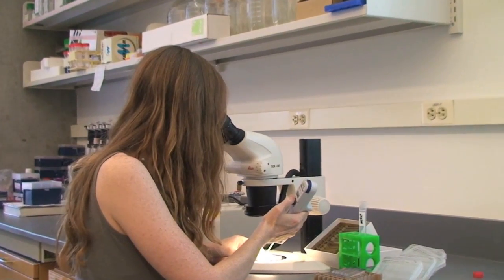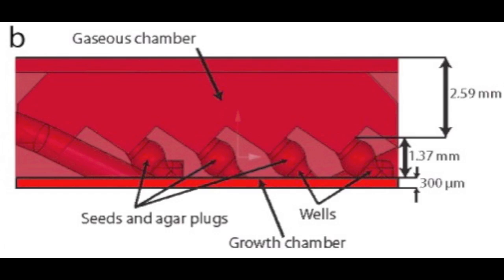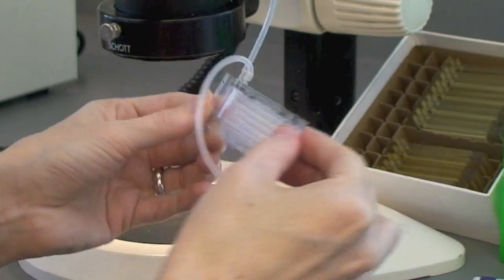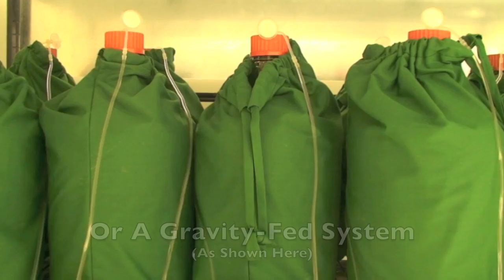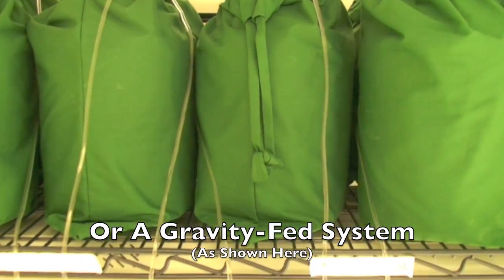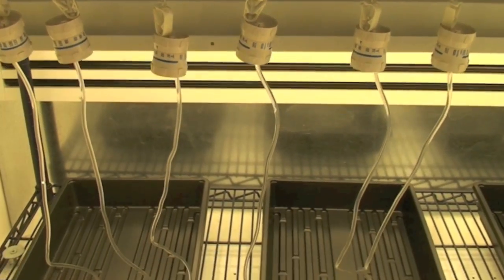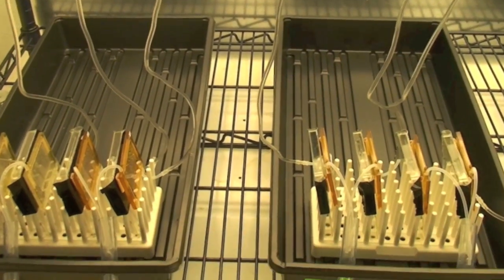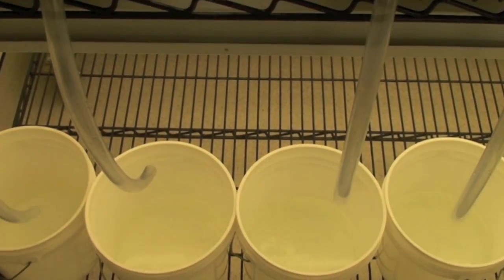Each of the RootArray's wells is filled with agar in which a single seed is planted. Ports at the side of the RootArray supply liquid and gaseous medium into the root and shoot chambers, respectively. Upon assembly, the complete RootArray is sterilized with a bleach solution and connected to a peristaltic pump, which supplies the gas and liquid to the system. This setup enables a continuous exchange of growth media and the application of chemical compounds, stains, and other exogenous treatments.